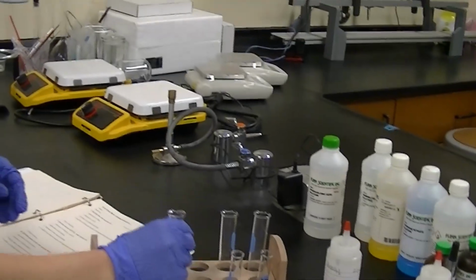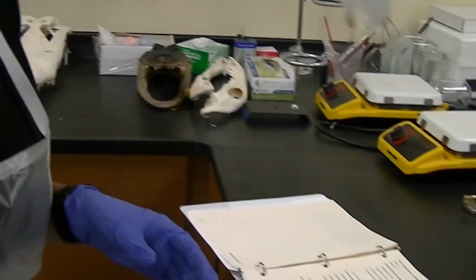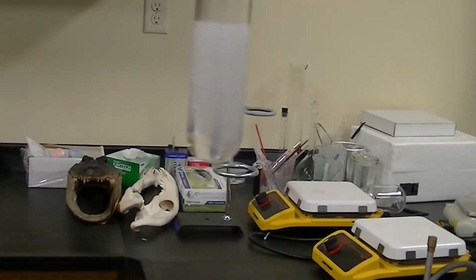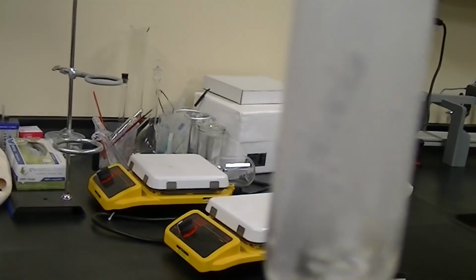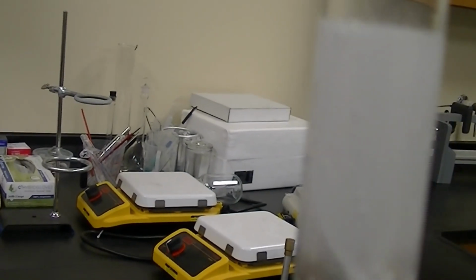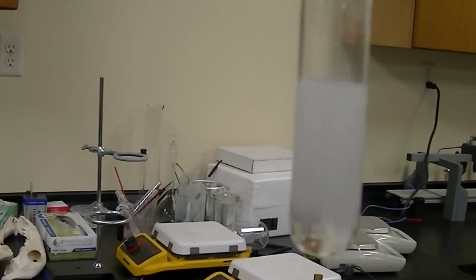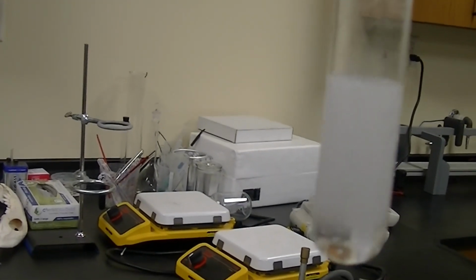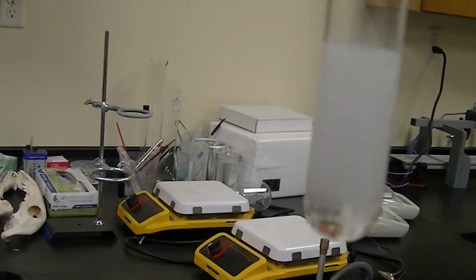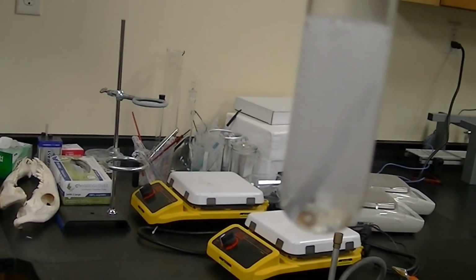Now before we end this, let's go back to the first reaction. It hasn't completely gone yet, but notice it's still going, right? This is the solid magnesium piece with the hydrochloric acid. You can see it's still bubbling. And if we waited long enough, we'd actually see that solid piece of magnesium would completely disappear. And it's not a magic trick, it's just reacting and forming a new compound and becoming an aqueous solution. But that is for you to predict and figure out. All right, and that is for experiment 9.